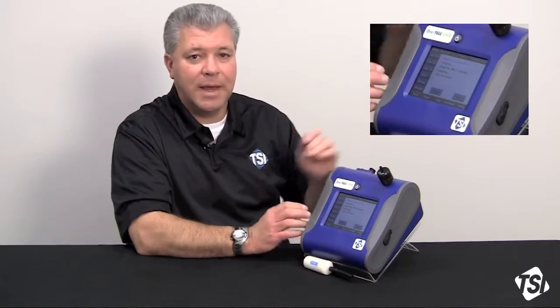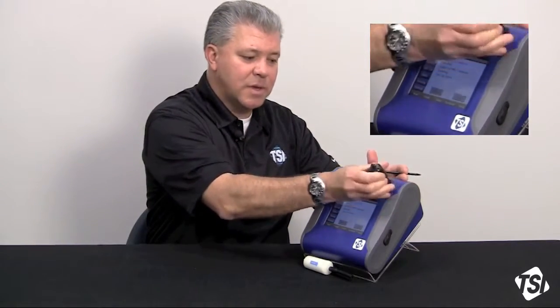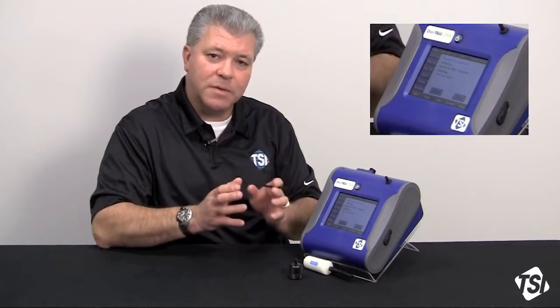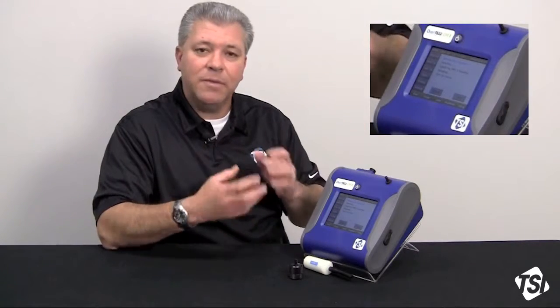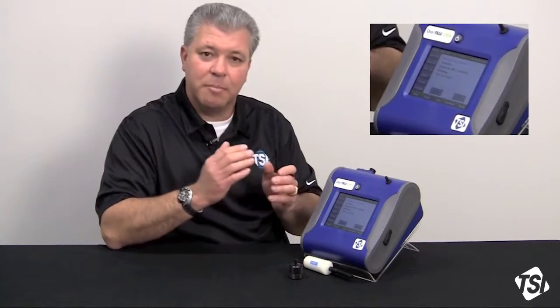This sampling can take anywhere from 2 to 10 minutes per sample — 2 to 10 minutes looking at total dust and 2 to 10 minutes looking at PM 2.5. The reason for the difference in time is that if you're in a fairly dirty environment with a lot of aerosol, it's going to take a shorter period of time to get a statistically valid sample. If you're in an environment with a very low concentration of aerosol, it's going to take longer to get enough statistical information to give us a good sample base to compare the total versus the PM 2.5 fractions.